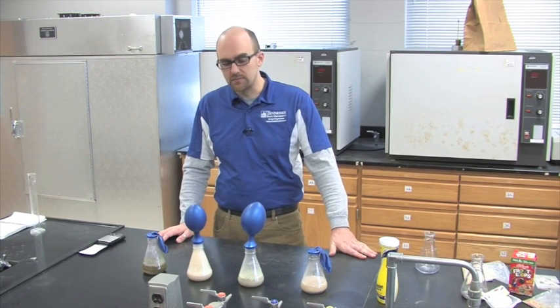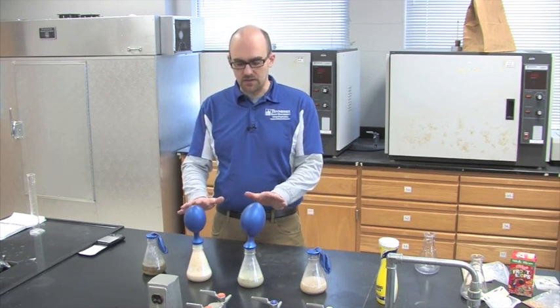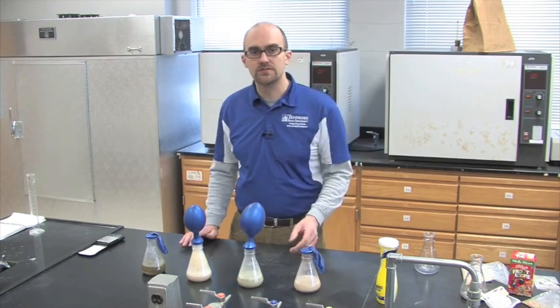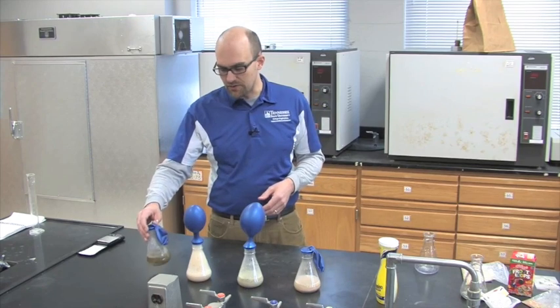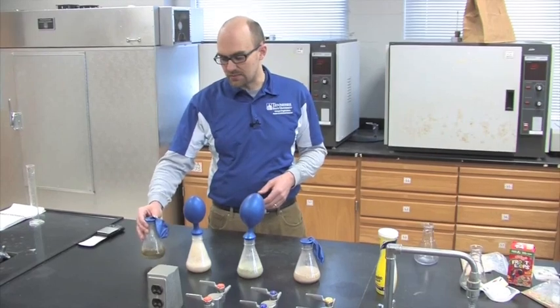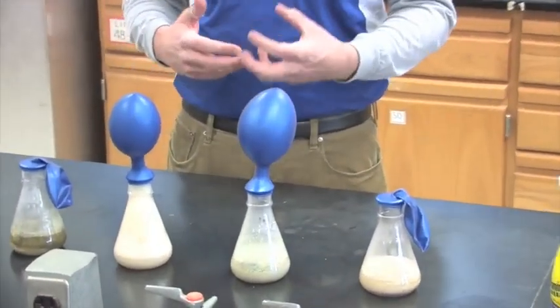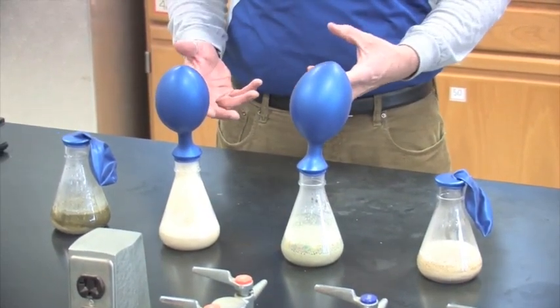We're back — it's actually been 20 minutes since we put the water in all of the flasks. You can see we've got some balloons that are filling up and some that aren't. The ones that aren't filling had low amounts of sugar, so they're just not going to produce as much ethanol or carbon dioxide. Same thing with the switchgrass — switchgrass doesn't have a lot of available sugar, as demonstrated by that balloon. Researchers are actually processing these plants more to allow more sugars to be released, but it does have a higher cost and takes more time.